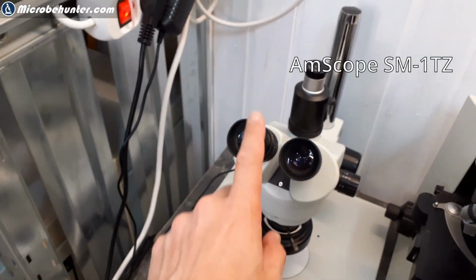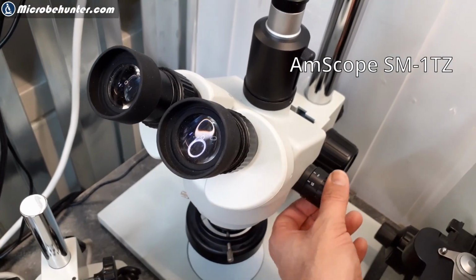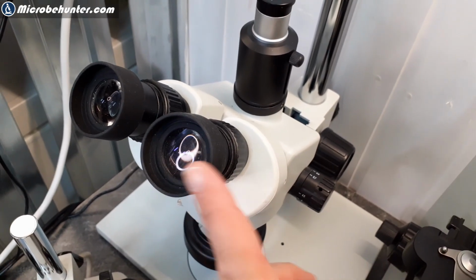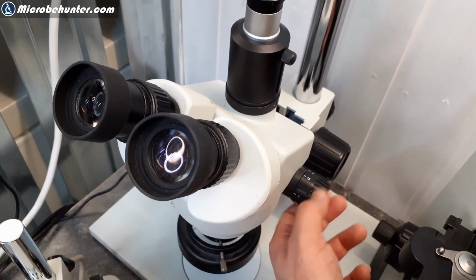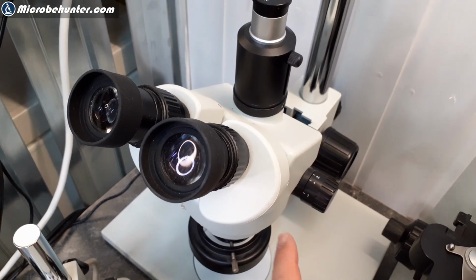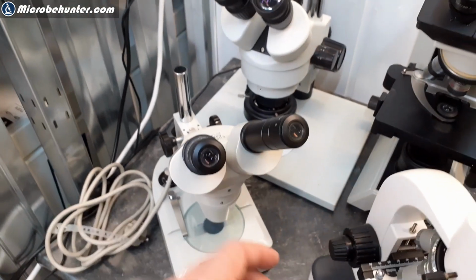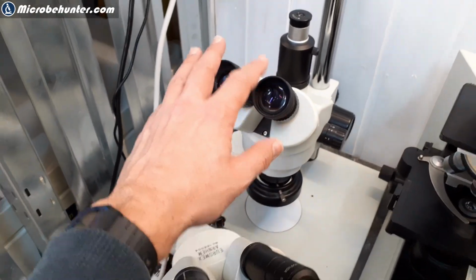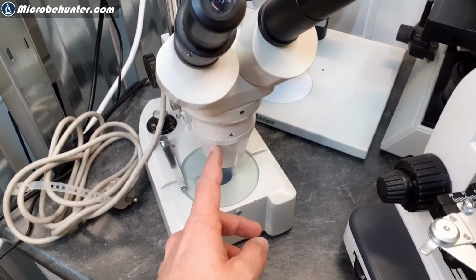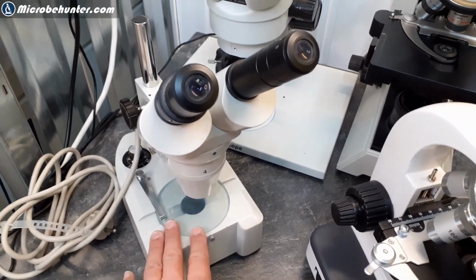And this microscope over here has a continuous zoom, a continuous magnification, which goes from 0.7 times 10, 7 times, all the way up to 4.5 times 10, which is 45 times. So it has a total magnification of 7 times to 45 times. You see that the range of magnification here is larger, and it's also a continuous zoom. And here I can only, in quotation marks, use 20 times and 40 times. In most cases, this is definitely enough as well.